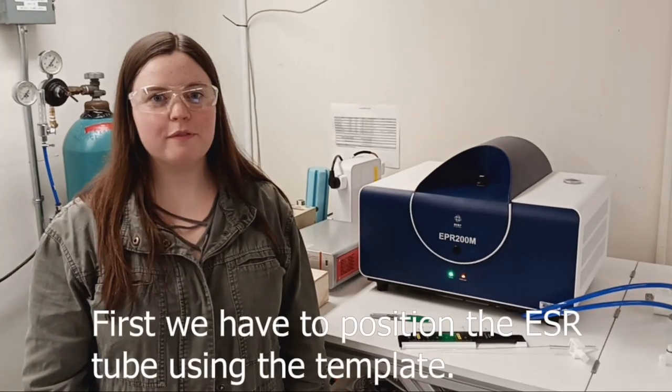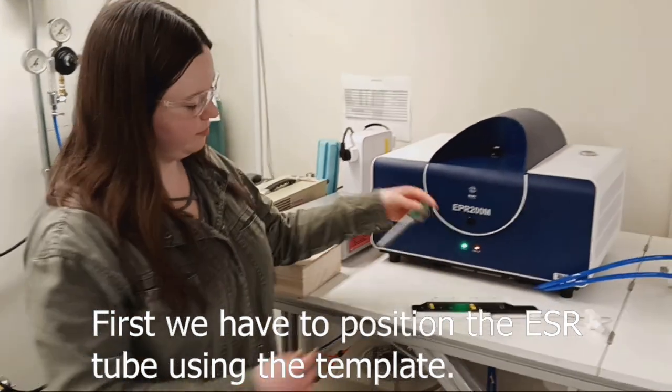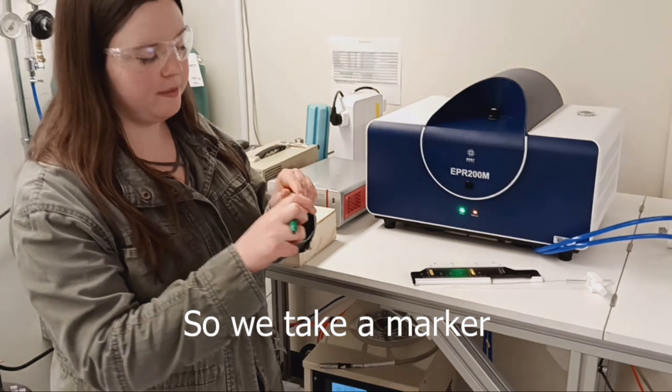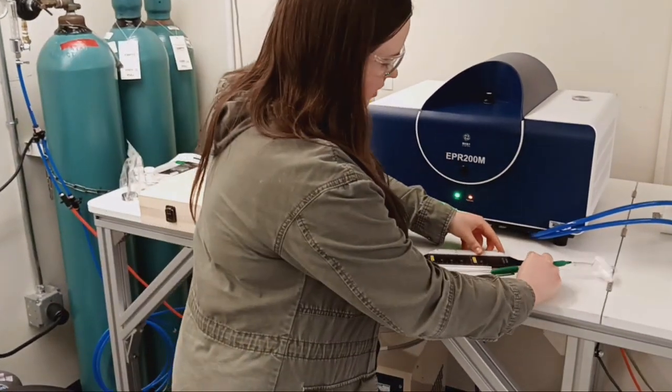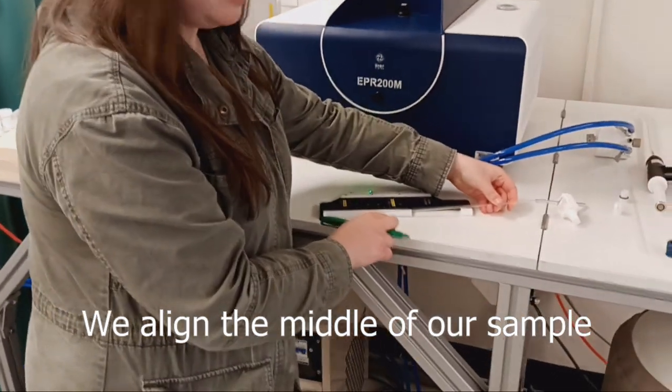First, we have to position the ESR tube using the template. So we take a marker, we align the middle of our sample to the room temperature height.